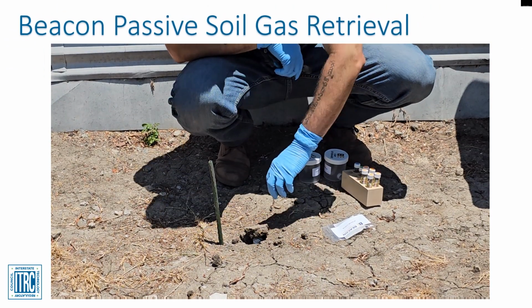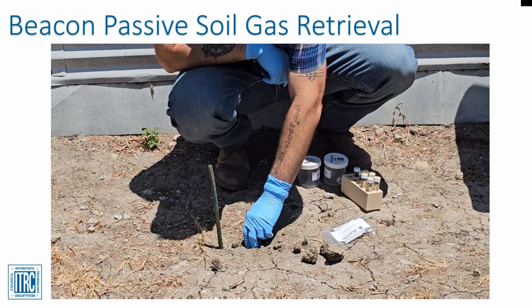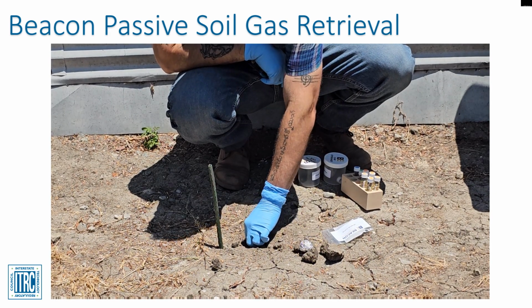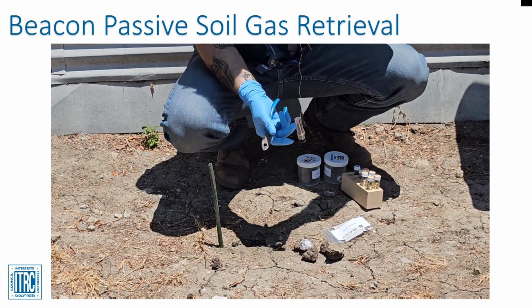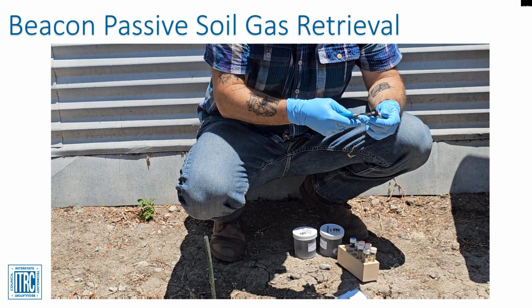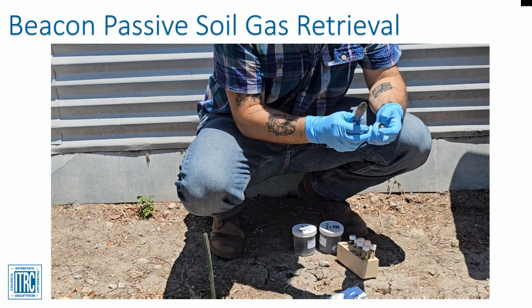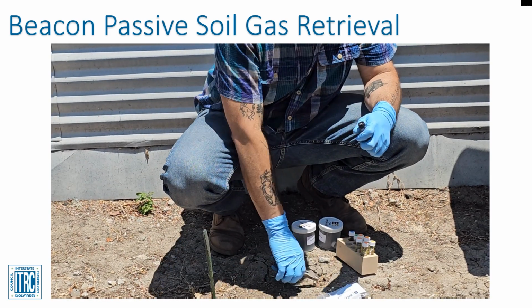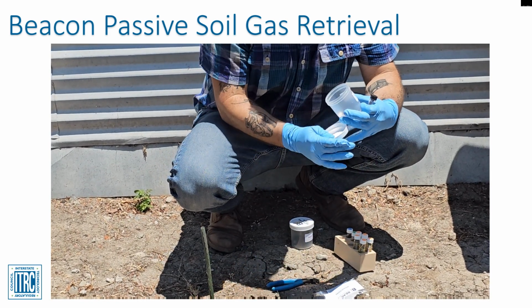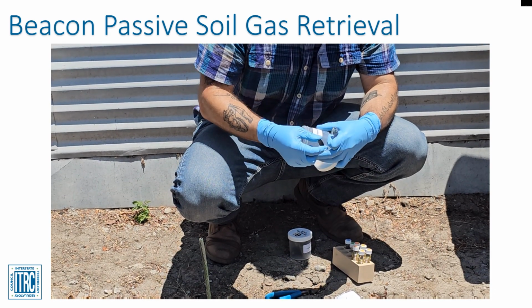Following installation, the samplers are deployed for a few days to weeks. Once the predetermined collection period is reached, field personnel should take the following steps to retrieve the samplers. First, the field personnel must remove the soil or thin concrete cap used to complete the hole to grade. If concrete was used, it should be able to be cracked with a small hammer. Once exposed, the field personnel will unplug the pipe and pull the sample out of the ground using the wire.